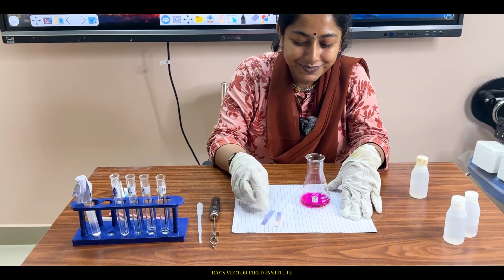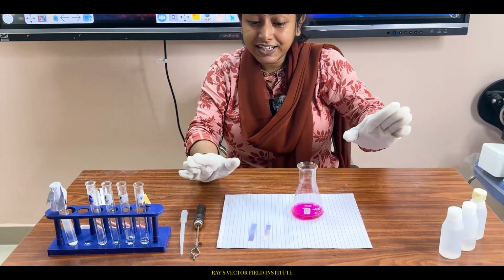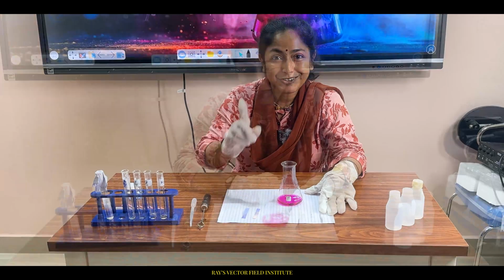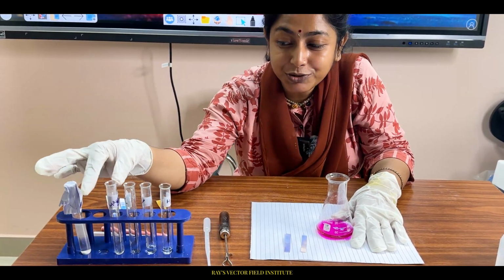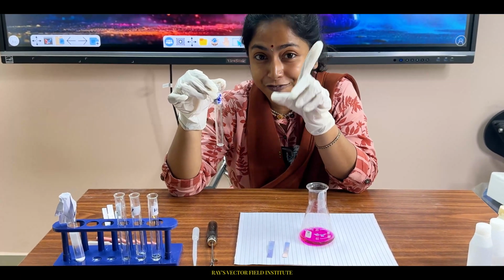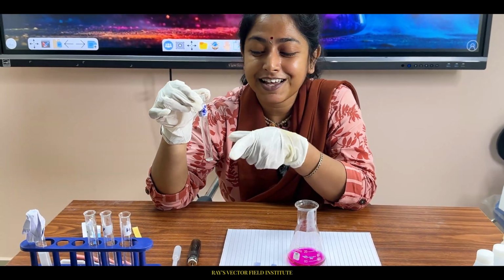So with this, we have concluded this experiment. The name of the experiment is acid base titration, and the drama is not yet completed. You need to tell in your comment section what is the name of this magic liquid, the indicator, the acid base indicator. Every student who is watching this video till the end, please comment.